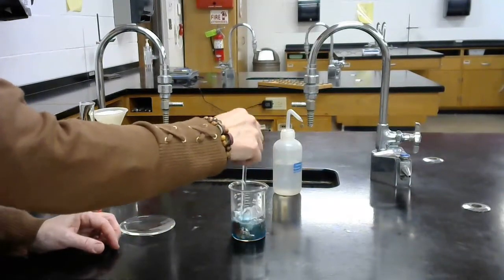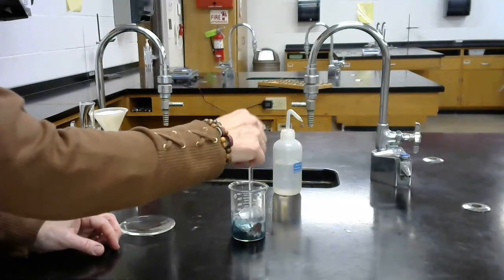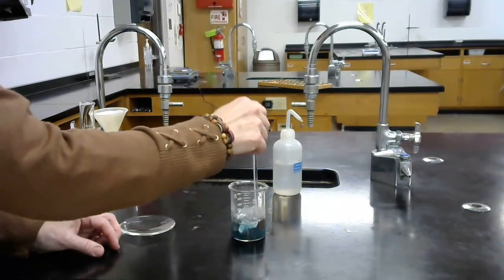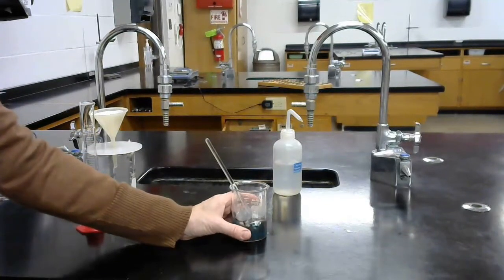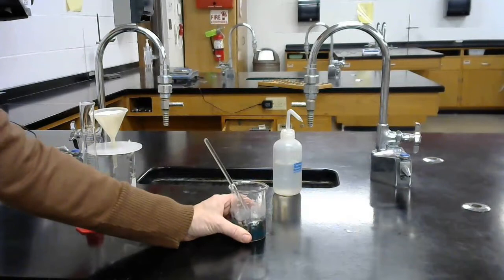So as this reacts, I can see there is a precipitate forming in there. And I can also feel that the beaker is getting warm to touch. There's some heat being generated.